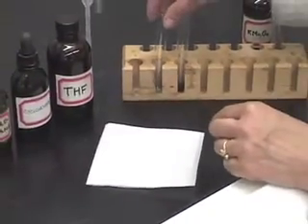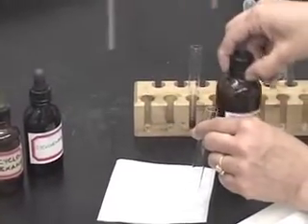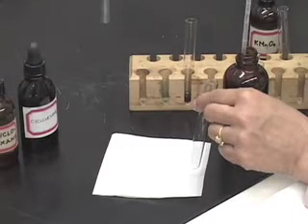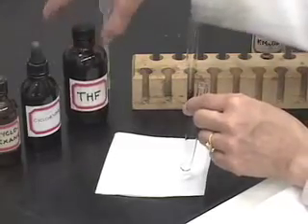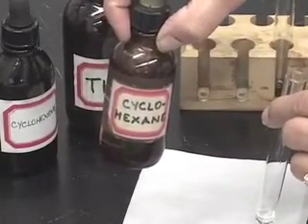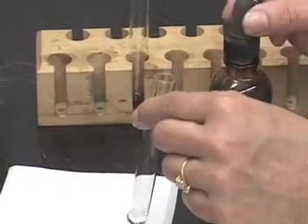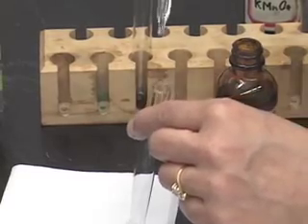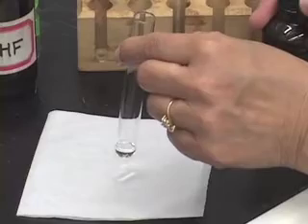Now let us do a test on a compound that is not unsaturated and see how that compares. Just like before, you are going to take 0.5 ml of THF in a test tube and add two drops of the test compound. I am going to test cyclohexane — as the name indicates, there is no double bond or triple bond in this compound. We all know that if the name ends in A-N-E, it is a saturated compound or an alkane. Mix the tube and add potassium permanganate dropwise.